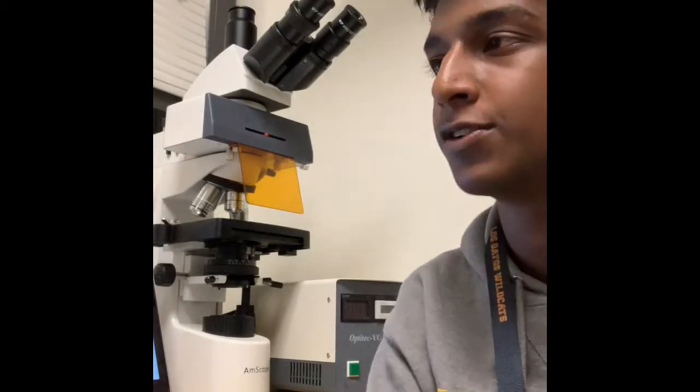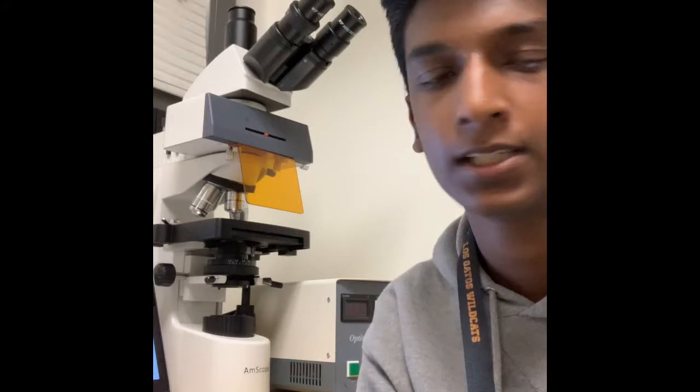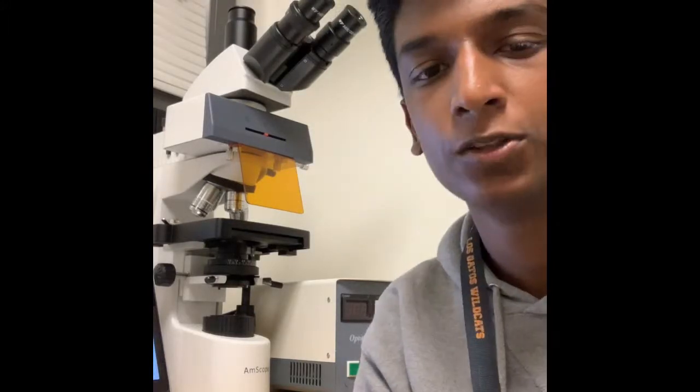So hey guys, it's me again, Deshaun, and now you've taken all the photos you need to be able to analyze your data for whatever trial you're on at this point. And I'll be helping you go through this process right now.